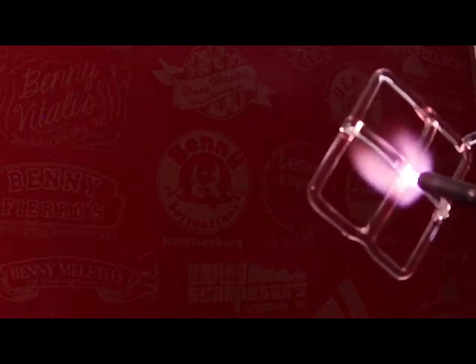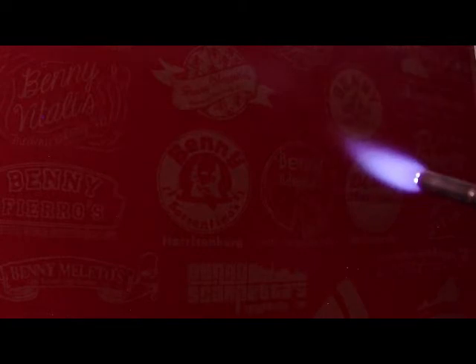I could increase the intensity of the torch right now, and that would certainly speed this up, but at the same time, I do like having this smaller, sharper flame. I could actually sharpen this up a little bit, but it's pretty good right now. I'm working with my left hand, as I mentioned a little while ago, that I don't want to do it this way, but it is a better angle for some of the welds that I'm trying to clean up, even though I risk, like I said, smacking the camera.